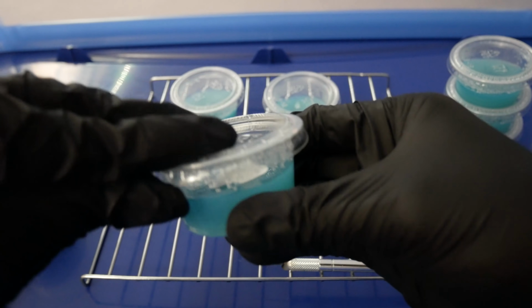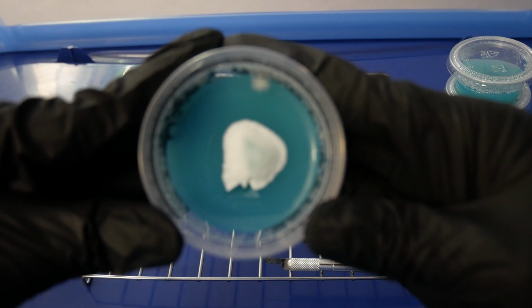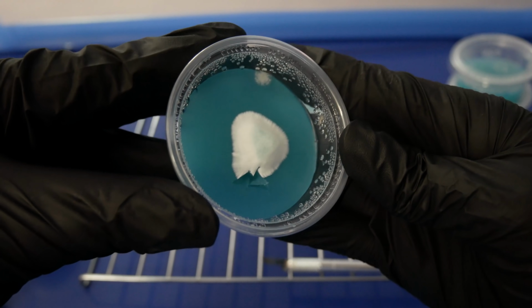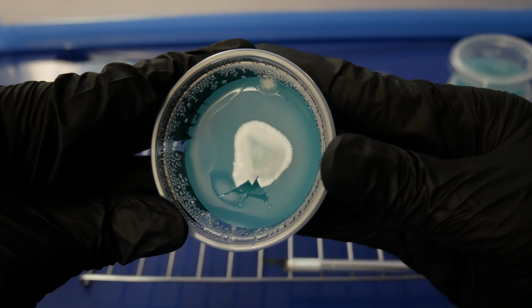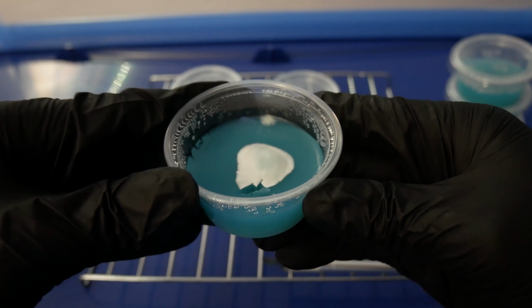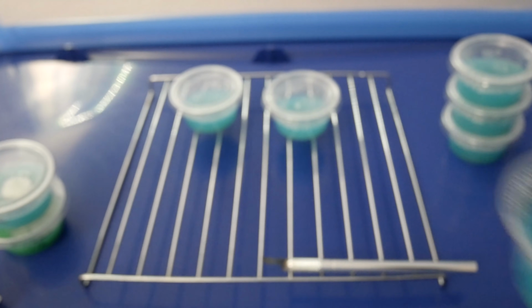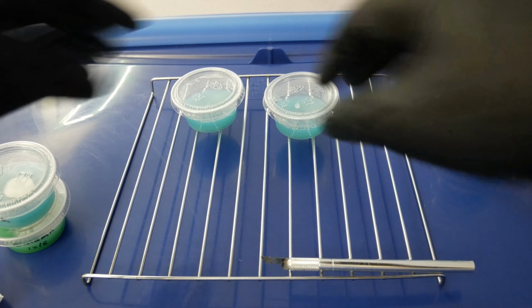All right, here we'll take a look at this. I'll open this back up. I'm going to be throwing away this cup anyway, so I'll give you guys a good look at this here. There's some contamination growth towards the top there. We really want to transfer the mycelium away while it's still in an early stage of growth. We don't want that contamination to spread and take over the cup before we try and clean it up. So the earlier you can transfer mycelium out from contamination, the better.